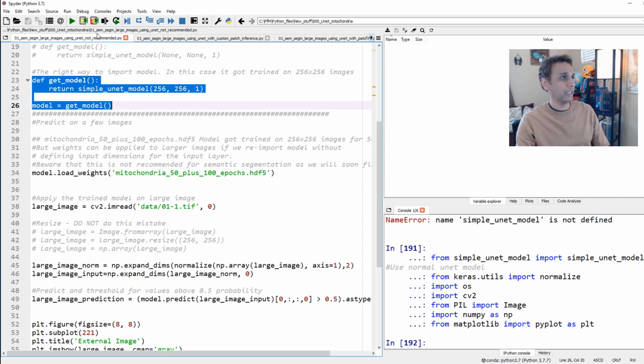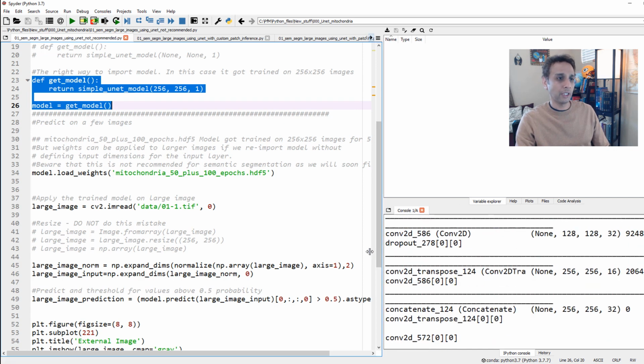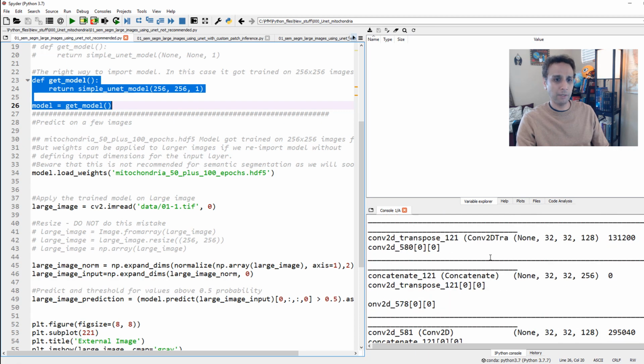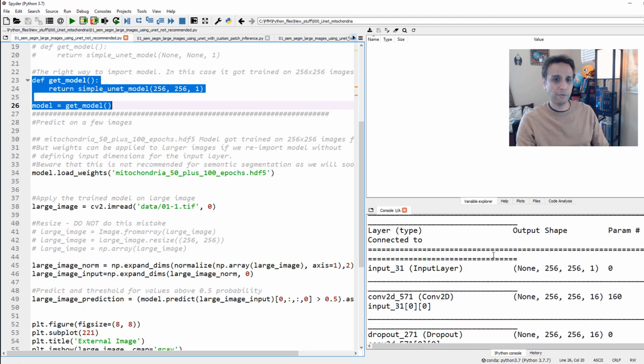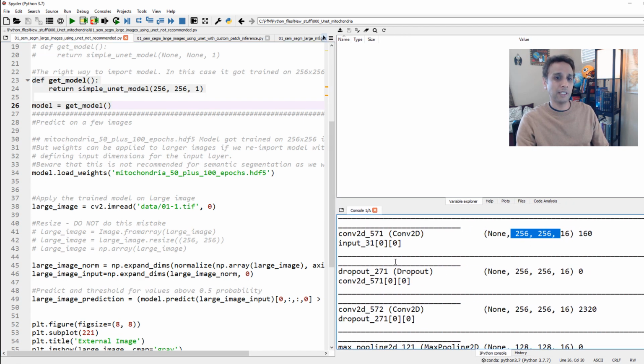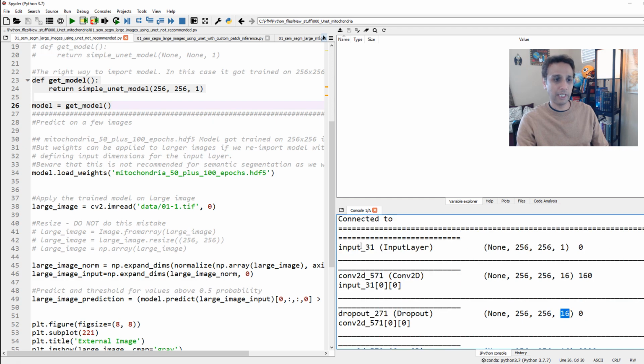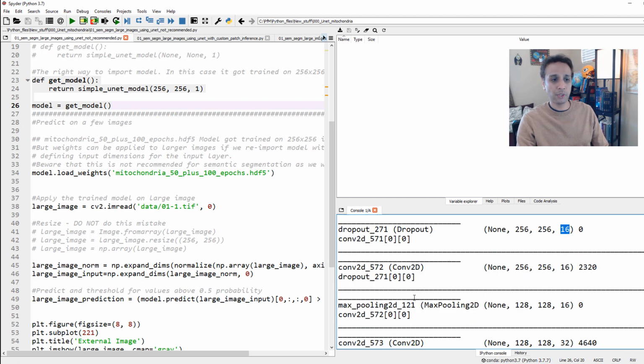Now go ahead and run these lines. Now you should see the summary of my model, and if I scroll all the way to the top, you should see that my input is 256 by 256 by 1, and then 16 filters right there, or 16 filtered images. Again, these are all convolutional layers and dropouts and so on.